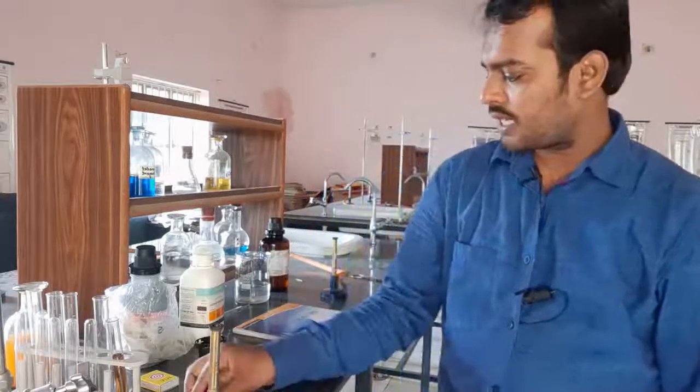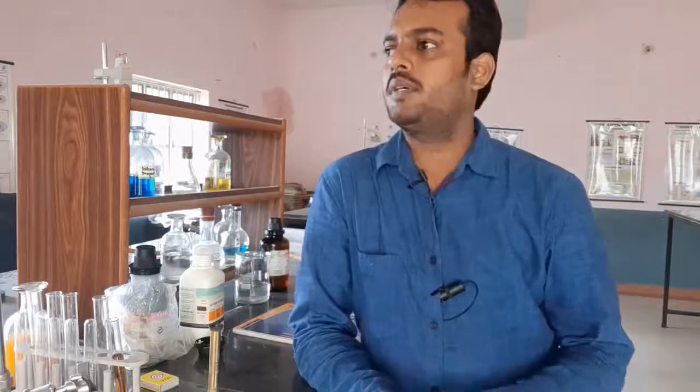Let us check what tests can be given. First, we will check whether the substance is aliphatic or aromatic. If a substance is aliphatic it will burn with white fumes, whereas if the substance is aromatic it will burn with a sooty flame and give black soot. Black soot means aromatic; white flames means aliphatic.